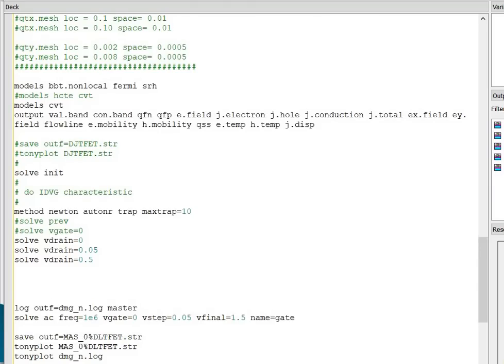Next you have to define the model. I have already explained in the previous videos about the different models used in the TFET. Next you have to save the file and you can view the file in Tonyplot. Next you have to give the voltage at different terminals. You have to apply 50 millivolt at the drain terminal. Next you have to save the log file.